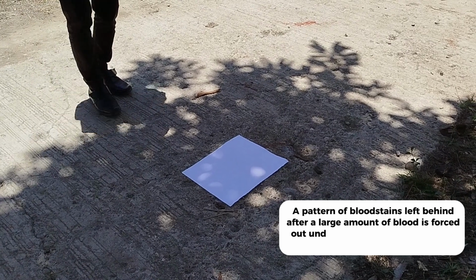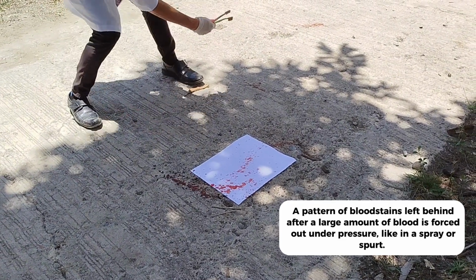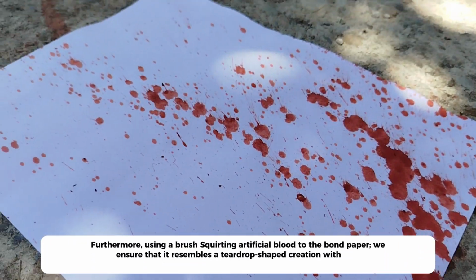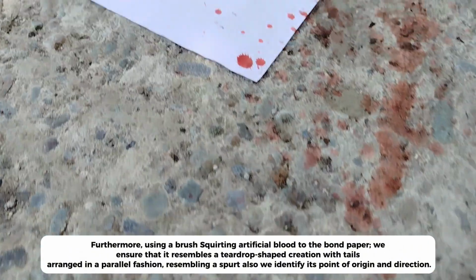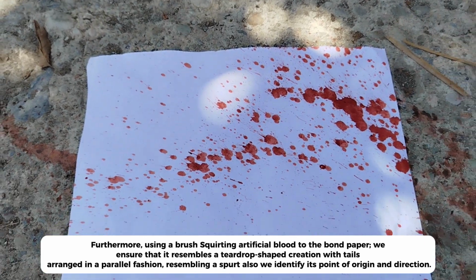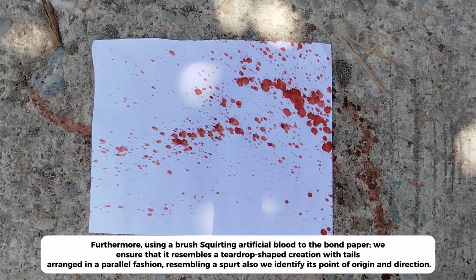A pattern of bloodstains left behind after a large amount of blood is forced out under pressure, like in a spray or spurt. Furthermore, using a brush to squirt artificial blood onto the bond paper, we ensure that it resembles a teardrop-shaped creation with tails arranged in a parallel fashion. Resembling a spurt also, we identify its point of origin and direction.